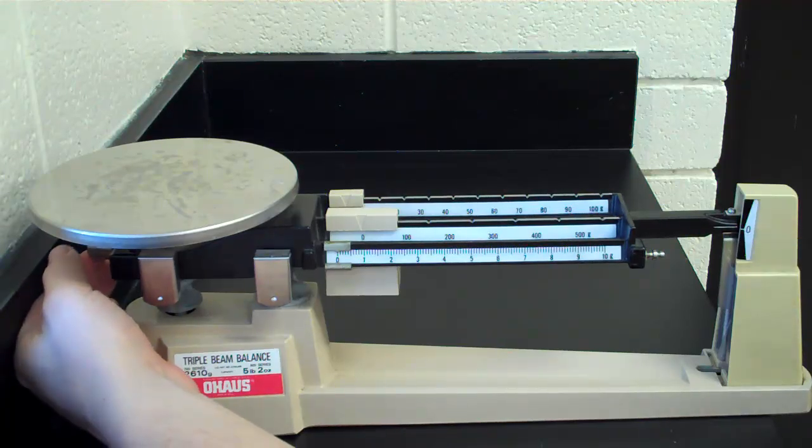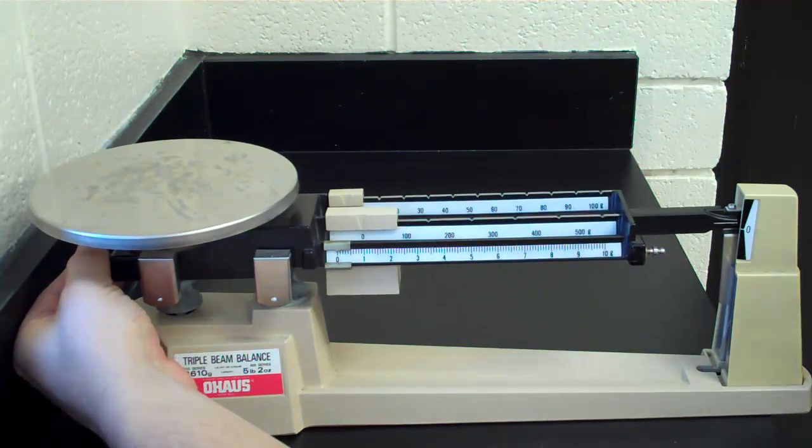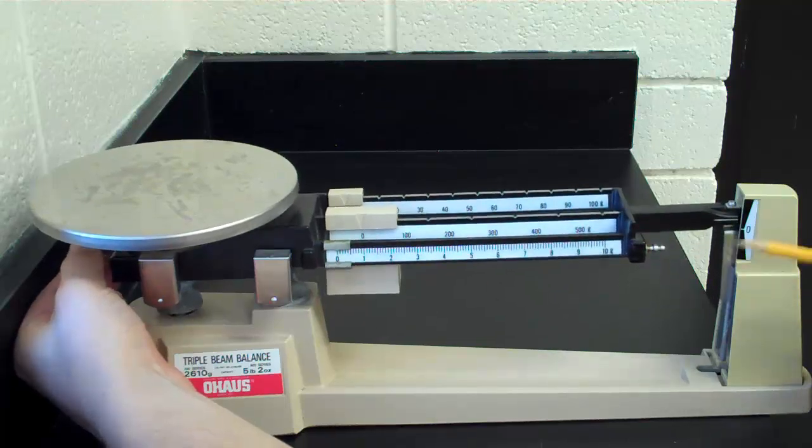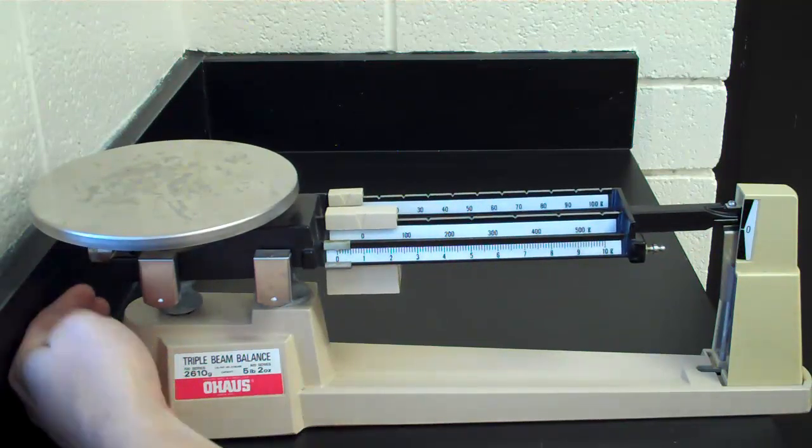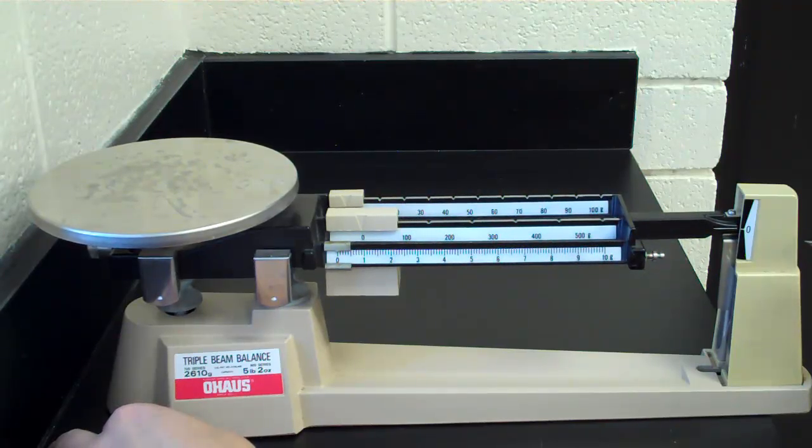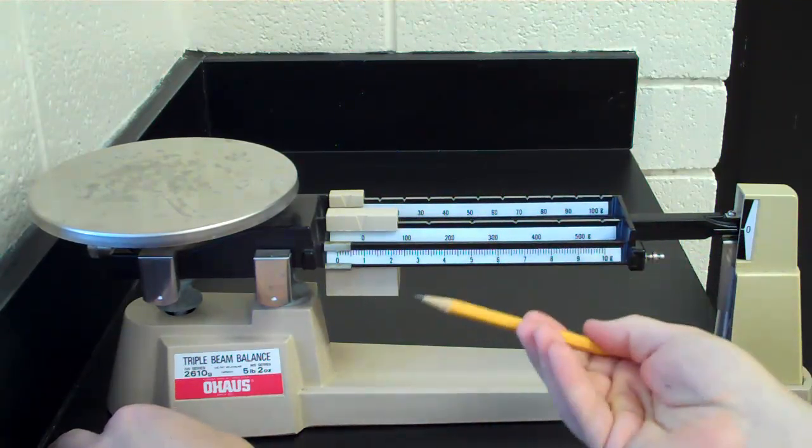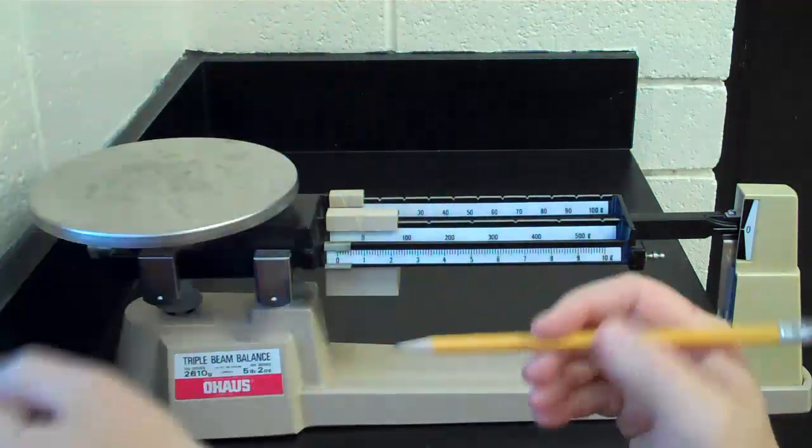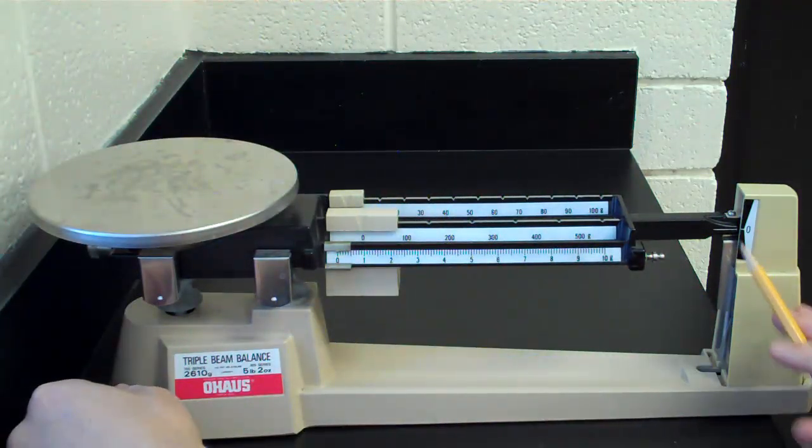It's still not quite lined up, so I'll turn it again toward you to bring that arm down. You just have to wait for that to level out. If this arm is down too far, we would turn it away from us. That is pretty close.